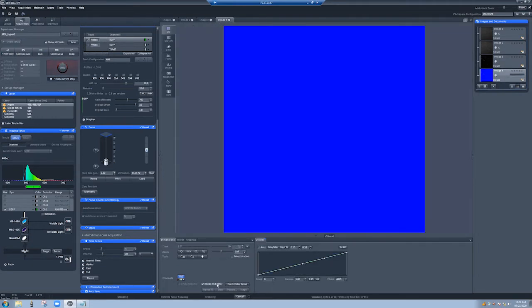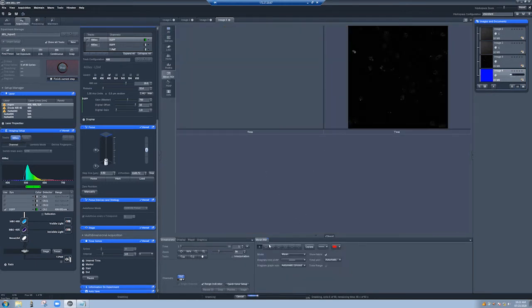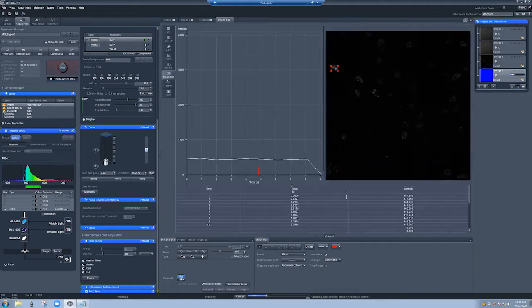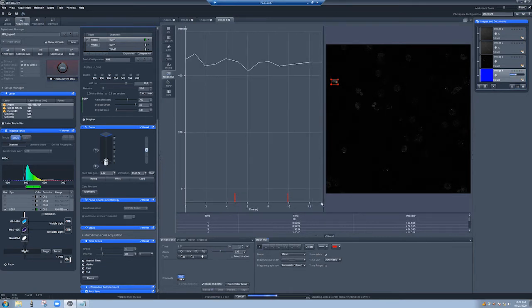I have to set up range indicator again. I'm going to go to mean ROI again. I'm going to draw a little box here. Move this. And zoom in. And so let's see if this changes the result. So far, it actually doesn't seem to be doing that badly. It's going down a little bit, but it wasn't the end of the world.